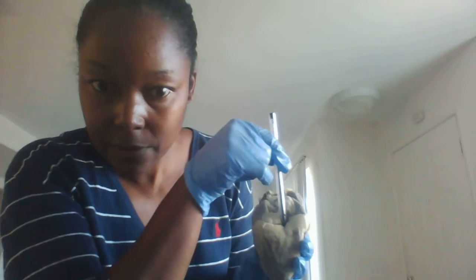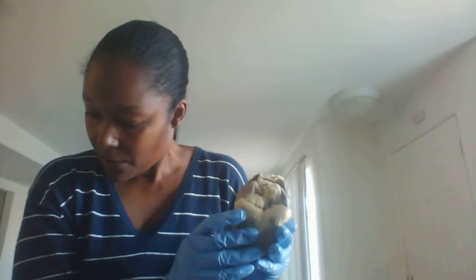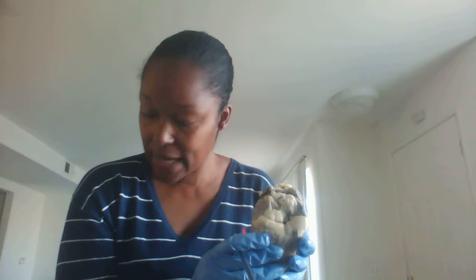All right, so we're going to look at the inferior and superior vena cava. So this is the inferior vena cava right there, and then this is the superior vena cava here. Okay. All right, the coronary sinus would be found along this line right here. All right, and the blood from the coronary sinus is coming to the right atrium. All right, and they're actually veins that are carrying deoxygenated blood.